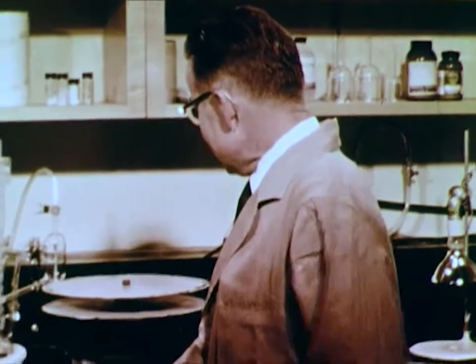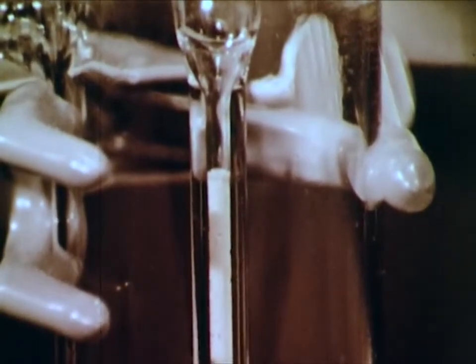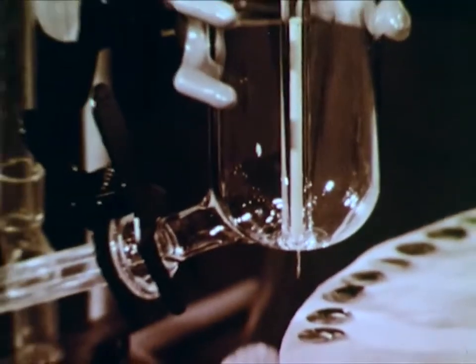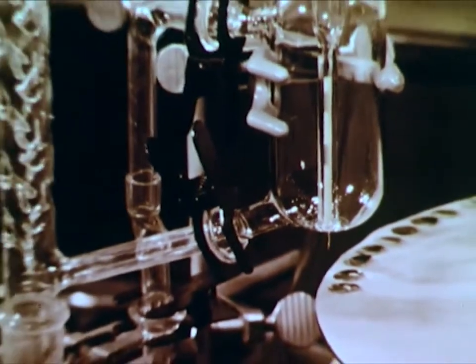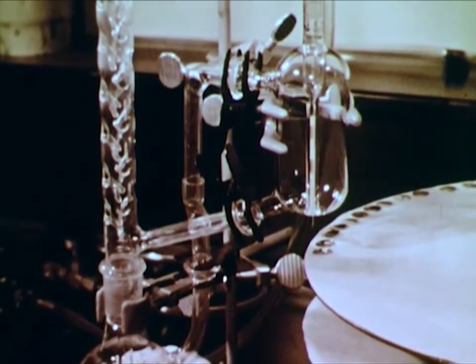Such key ion exchange experiments involved in the discovery of many of the transuranium elements were performed by Dr. Stanley G. Thompson. A separation by ion exchange is an extremely powerful, yet surprisingly simple technique. We use many different sizes, but in principle all columns are the same. The column consists of a glass tube packed with an organic resin. The tube is surrounded by a glass jacket containing a hot vapor to speed up the reaction. Now let's see how the ion exchange column helps us separate and identify rare-earth elements.